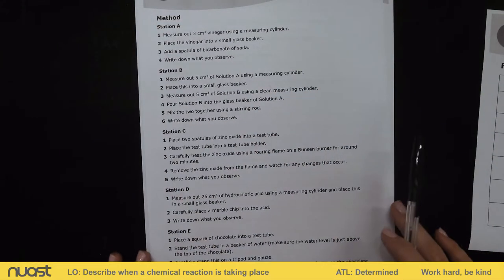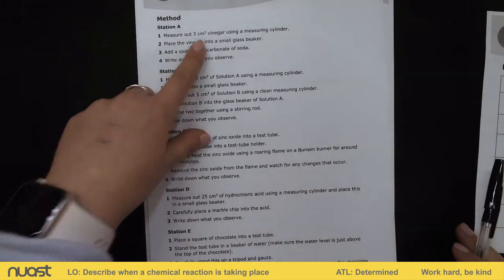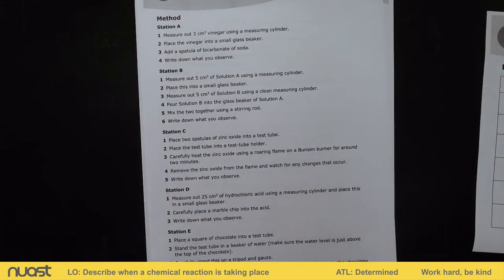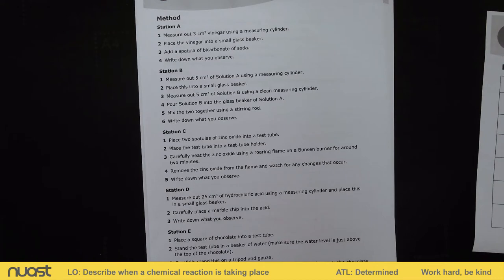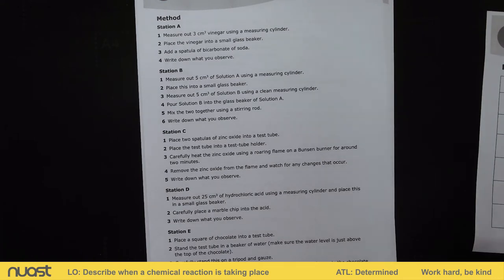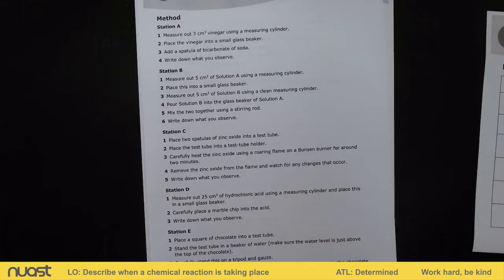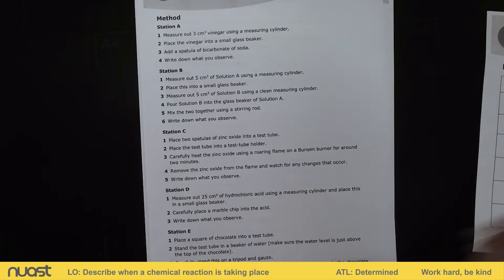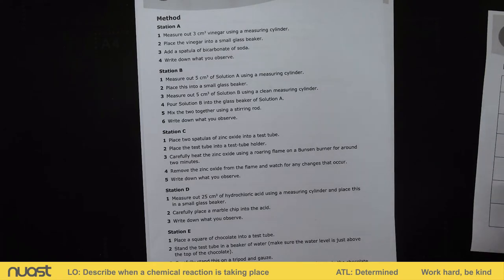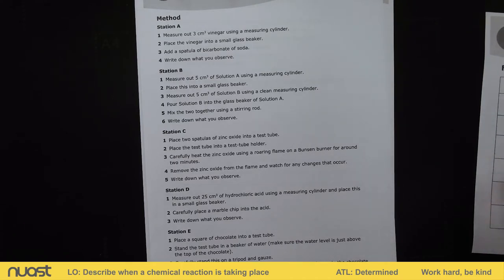Looking at station A, we're going to use three centimetre cubed of vinegar, add that to a glass beaker, then add a spatula of bicarbonate of soda. Then we're going to write down in our observation table what we have seen.